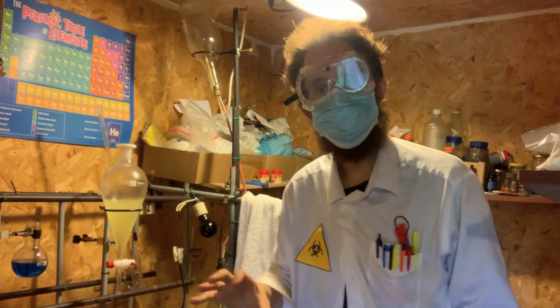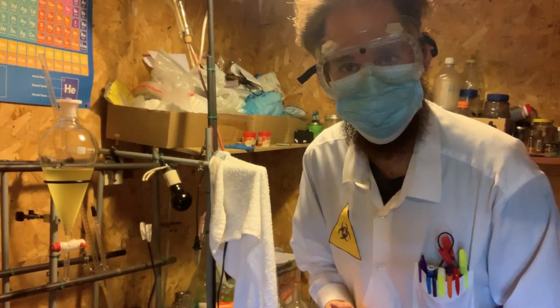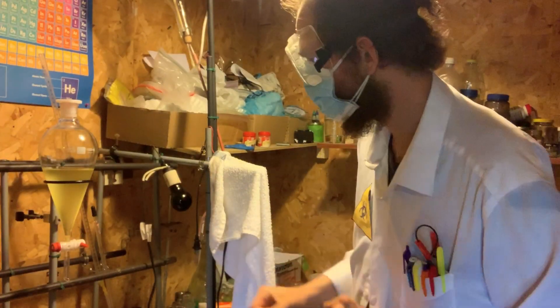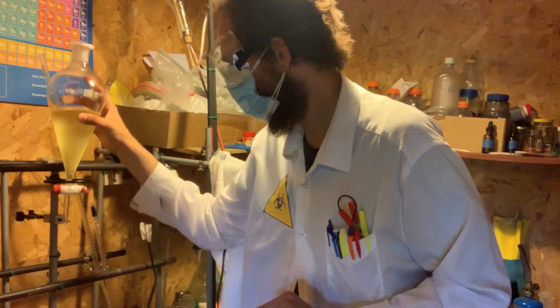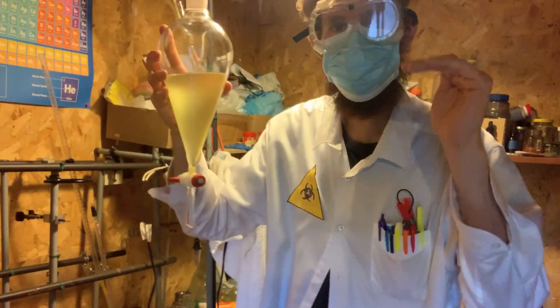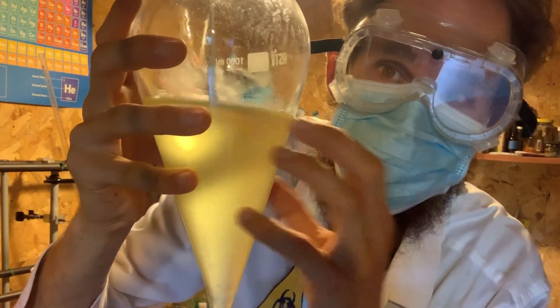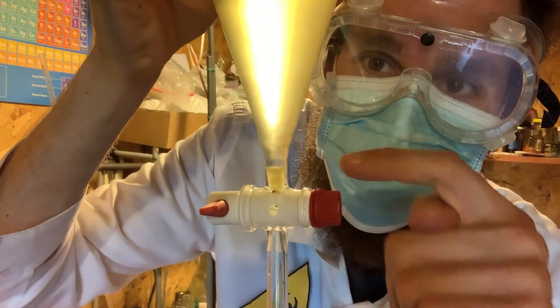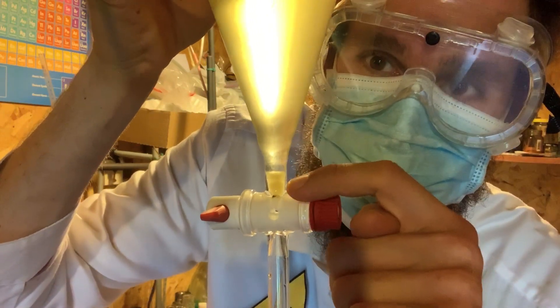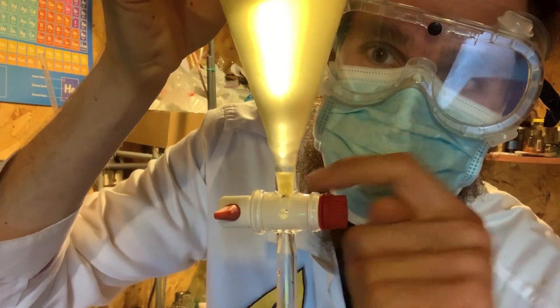All right, so an hour has passed and this has been standing. Let me show you what I have here. There are two layers. You can see the top layer we don't want, but the bottom layer, a very small yield, this is our bromoform.